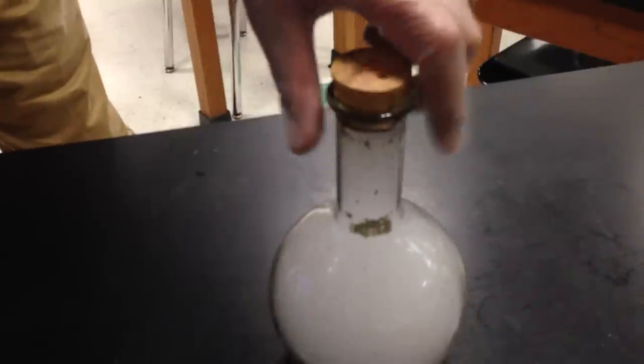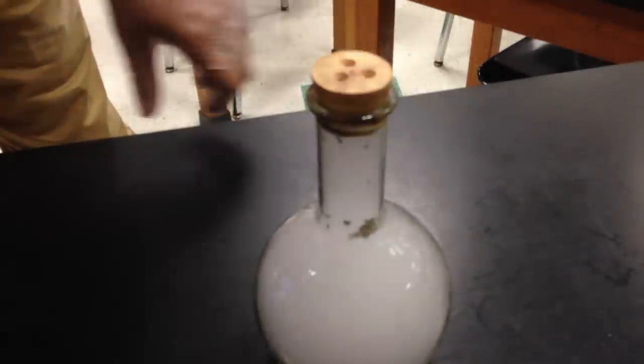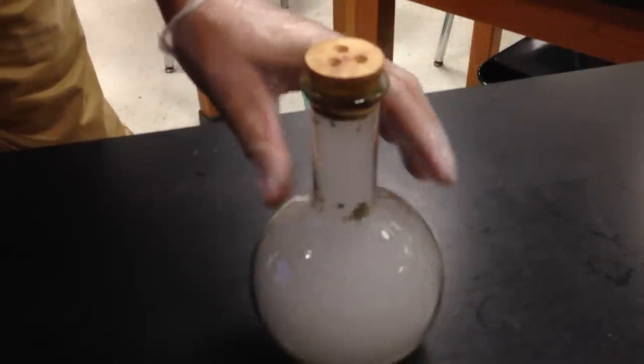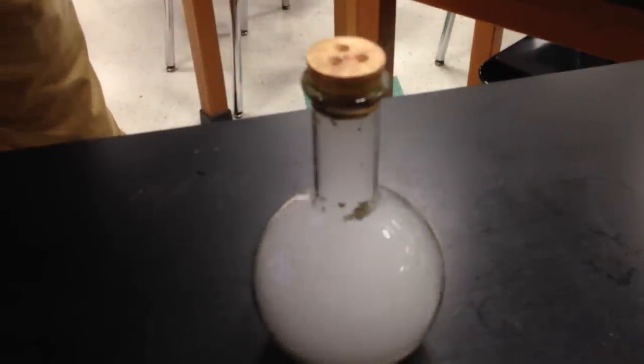And if you look carefully, you might see a brownish-red gas, and that would be NO2 being produced. But we've got some gas in here. And all I've got to do is wash this out. And our flask is nice and clean, although I might need a little bit more. And our flask has been cleaned.